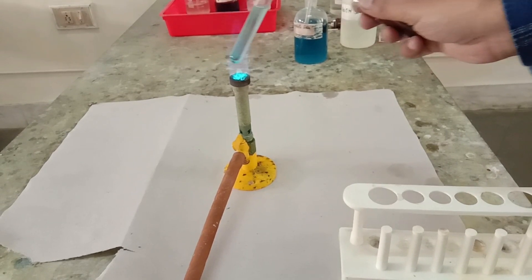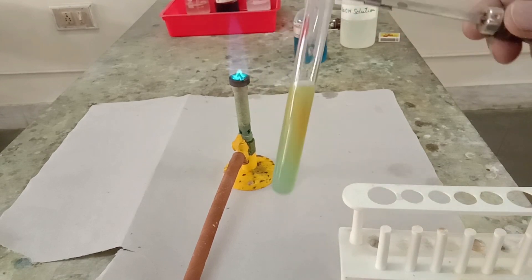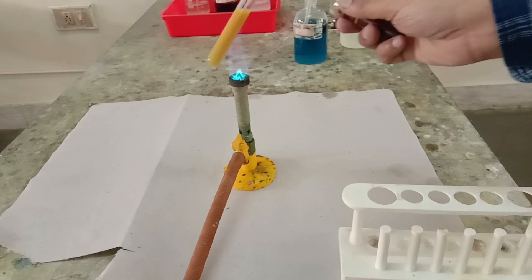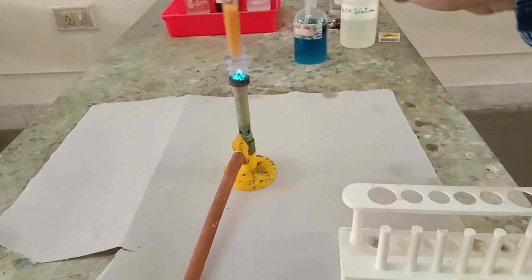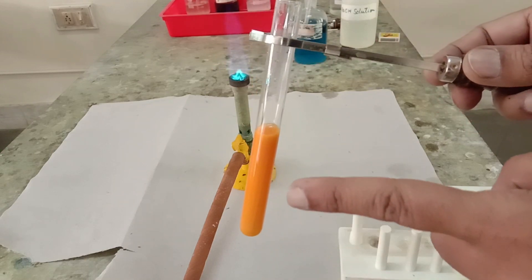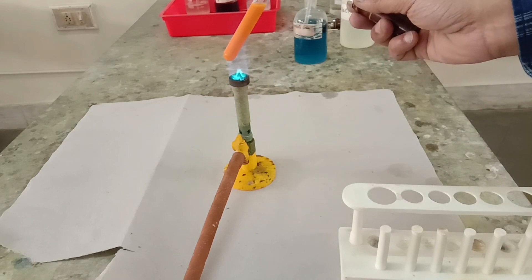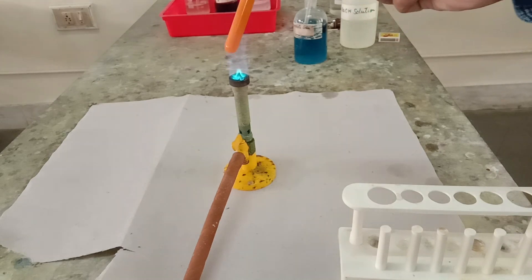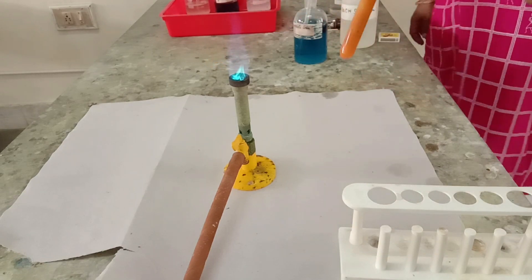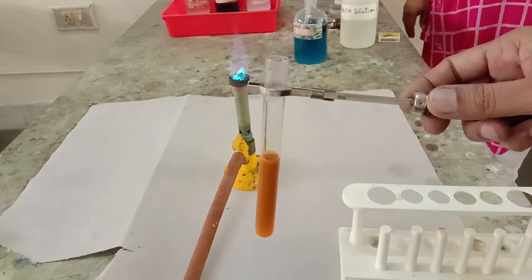On gently heating the mixture over the Bunsen burner, we will find that the blue color of Benedict solution starts converting into light greenish in color, and finally it will turn into brick red in color. So if the Benedict solution, which was light blue in color, turns into brick red at the end, it indicates the presence of sugar in the solution.